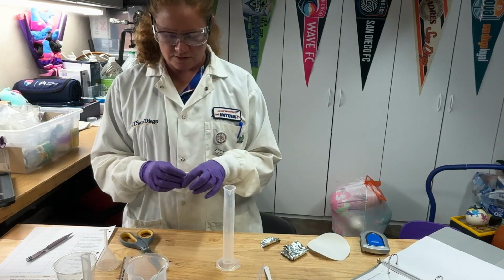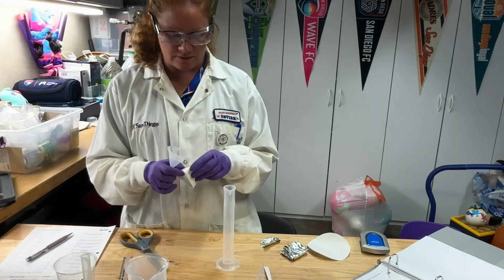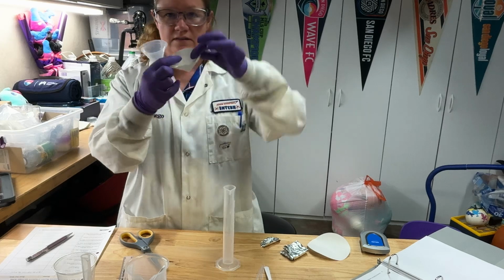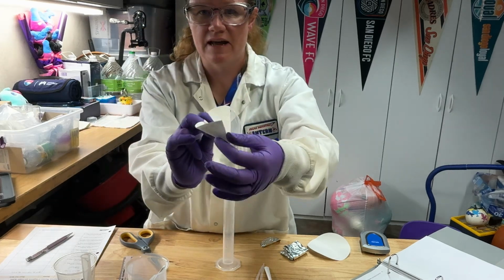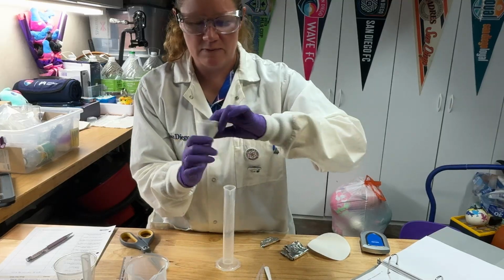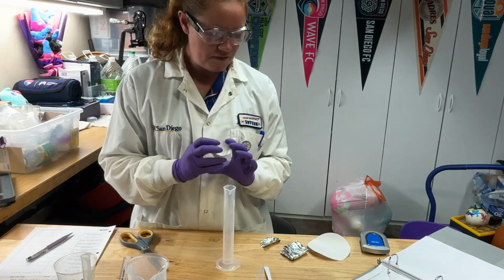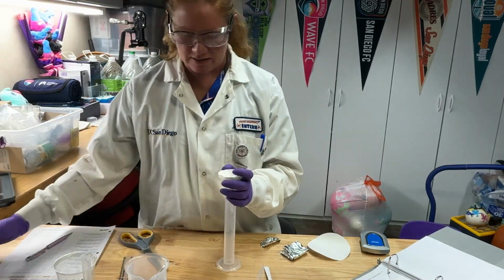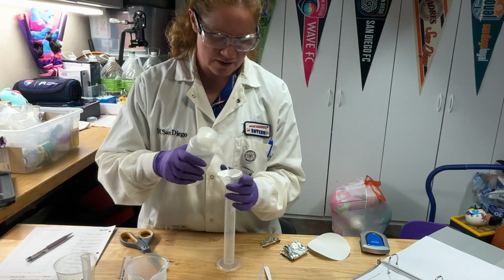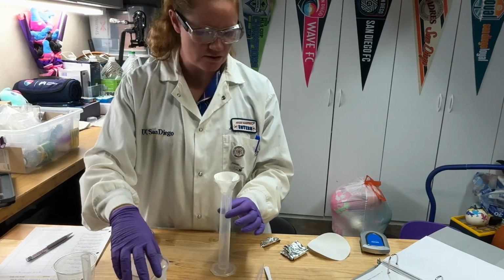Okay, so we'll go ahead and get this inside of our little funnel here. You may need to kind of fold some of the edges around like that. So I folded that edge and I folded that edge. So that way it fits inside of my funnel. Okay, so it's gonna look like that inside of your funnel. Now, one thing is that it helps if you rinse this down a little bit first, because that helps the funnel or the paper stick to the sides of the funnel and hold its shape a little bit.